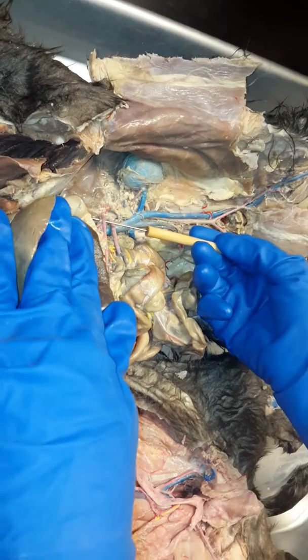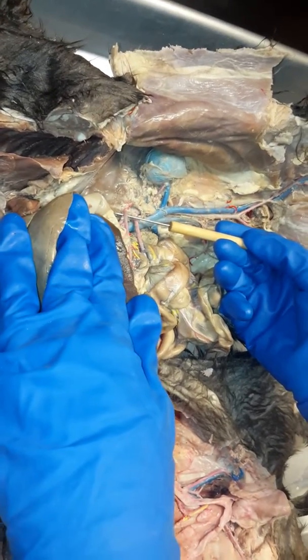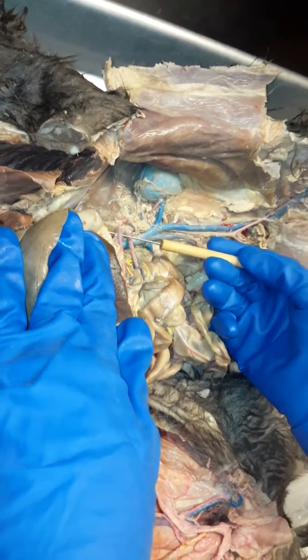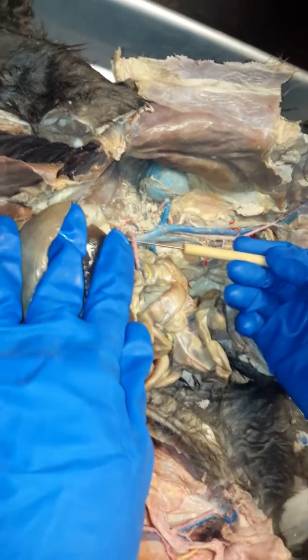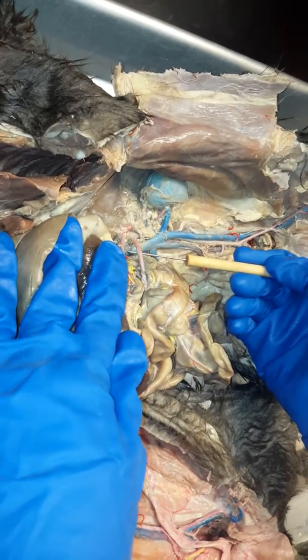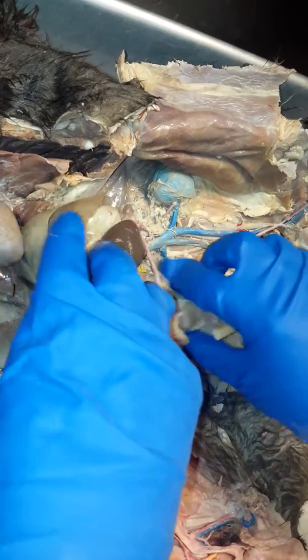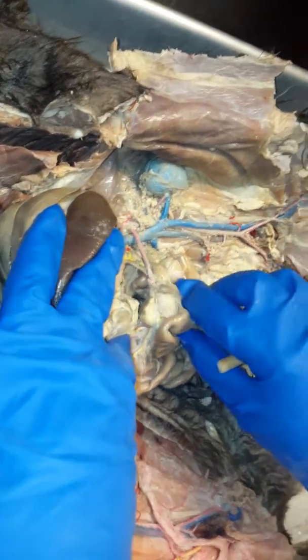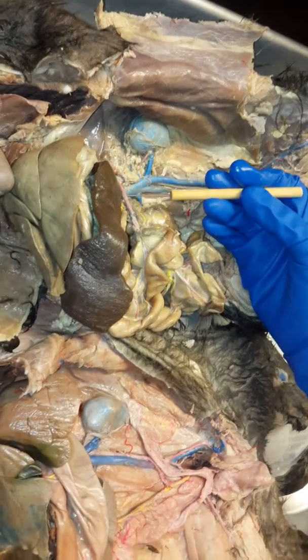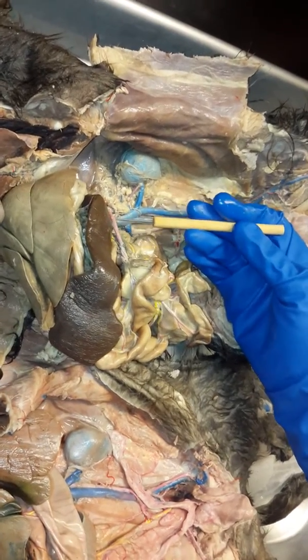This very top artery, does everyone see it? Very top artery is the celiac trunk. It's going to go to the stomach, celiac pertaining to the stomach, okay? So it's going to supply blood to the stomach. This second one, right below the celiac, is going to be the superior mesenteric, okay? Mesentery is all of this connective tissue stuff that's holding all of the intestines together. So the superior mesenteric, since it's above, superior, it's going to supply blood to the small intestines, okay?